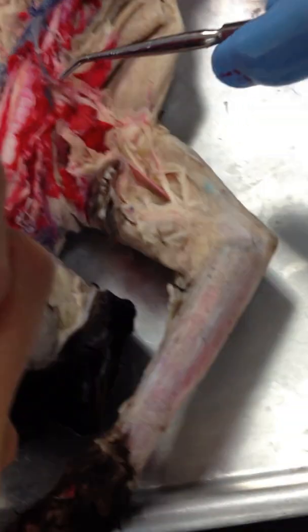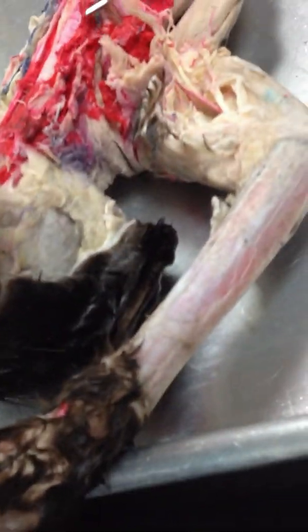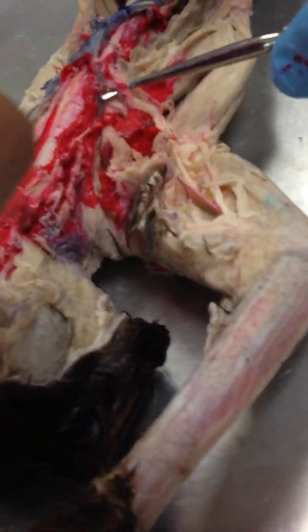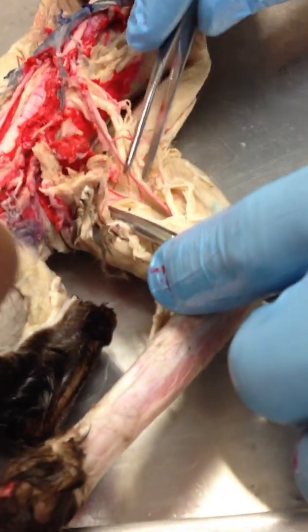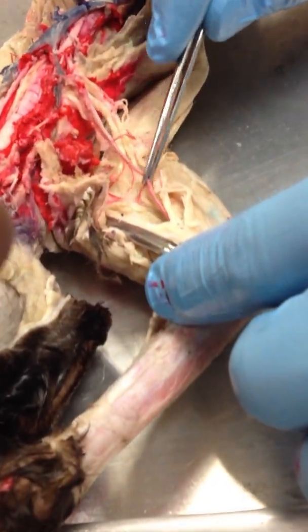The right subclavian is going to continue out, and when it reaches the axillary region — the armpit — we call it the right axillary artery. And then where it continues further across the arm, we call it the right brachial artery.